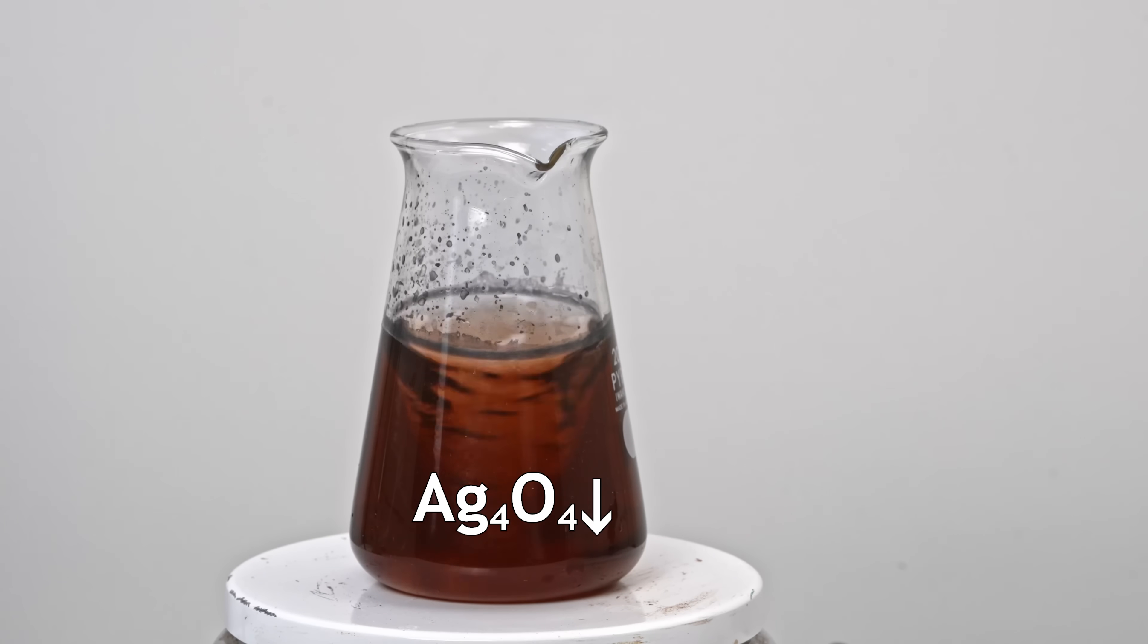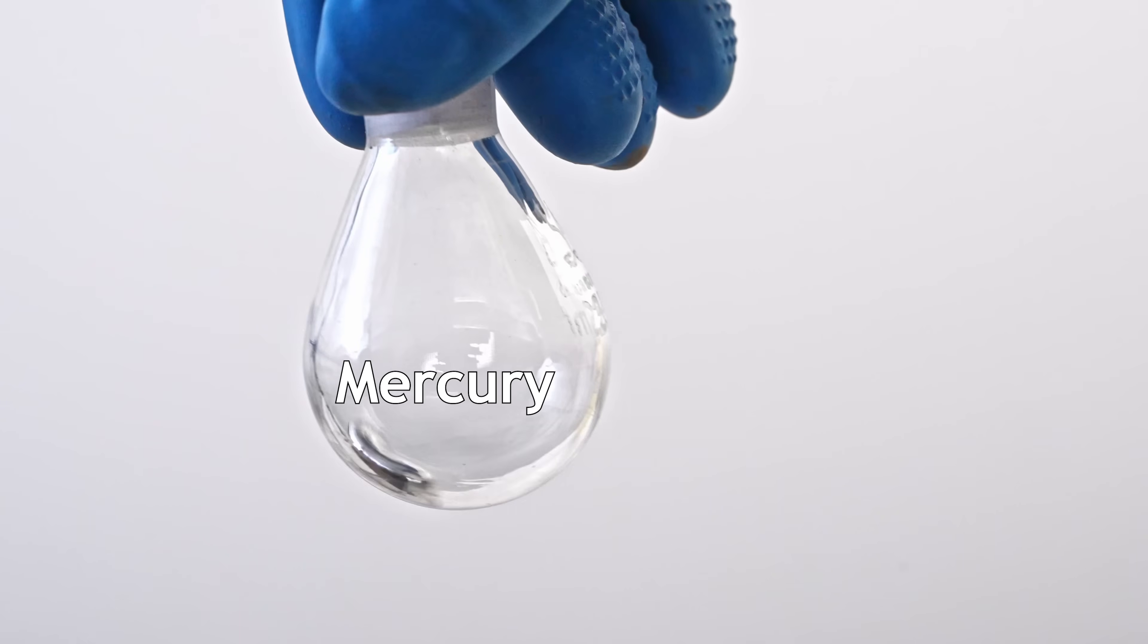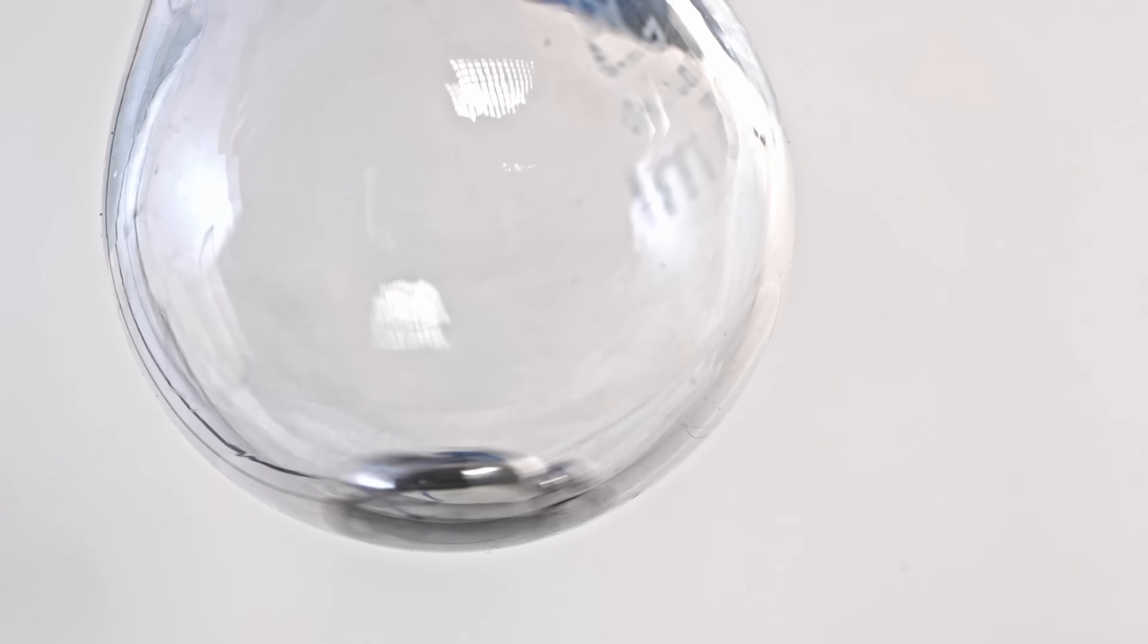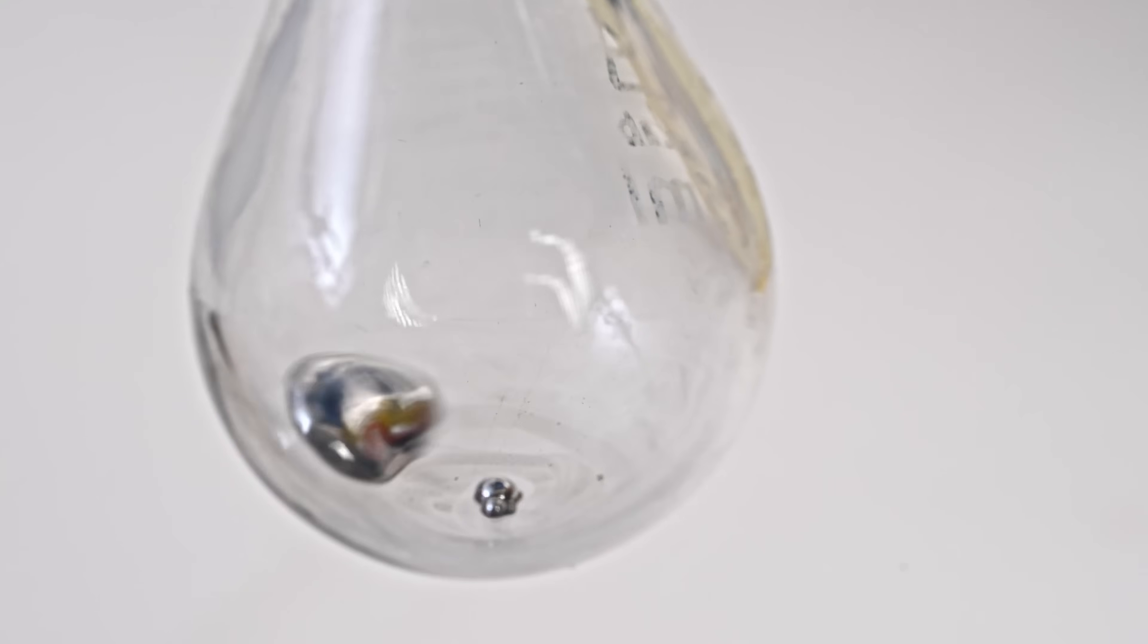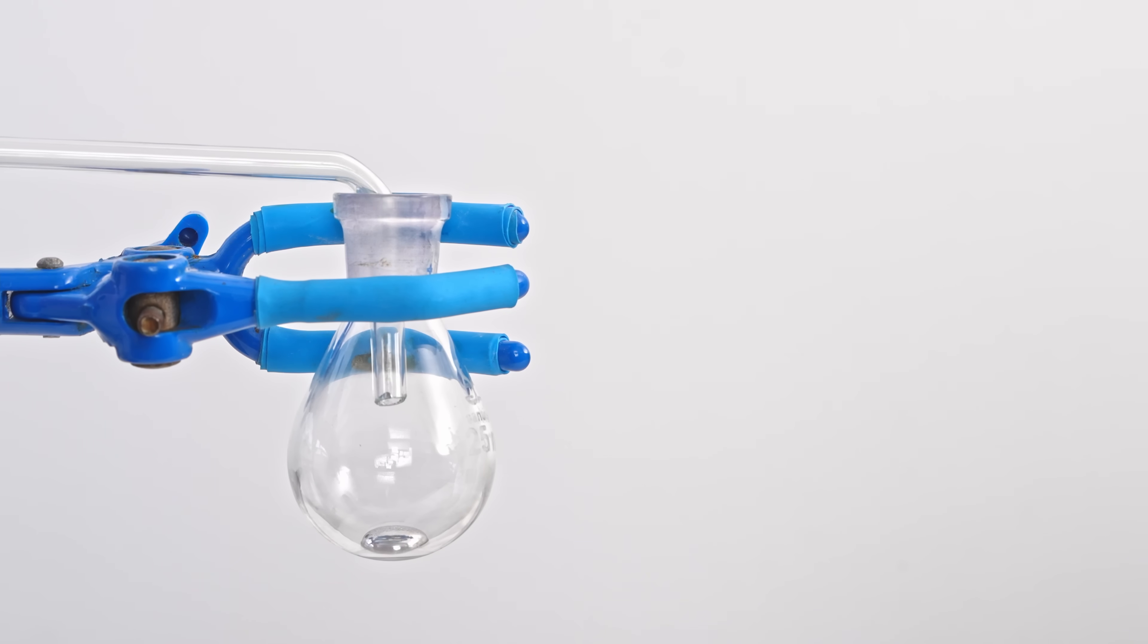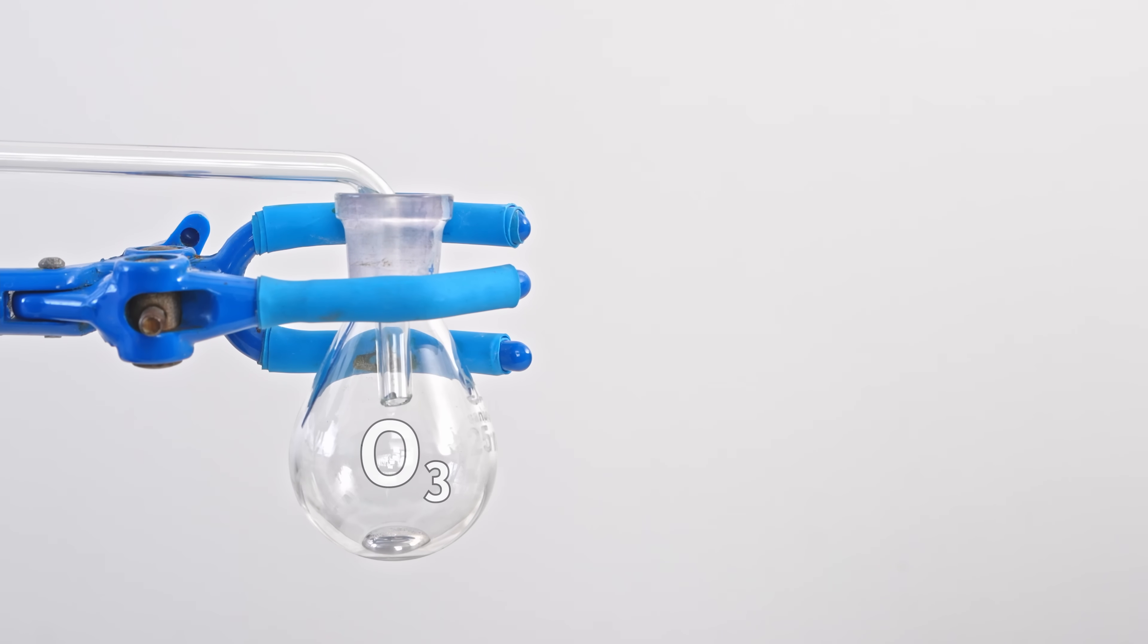At room temperature, gaseous ozone can oxidize most metals. Let's explore some of the most interesting reactions. In this small flask I have a bit of mercury, which doesn't wet glass. Let's see what happens when I expose mercury to ozone.